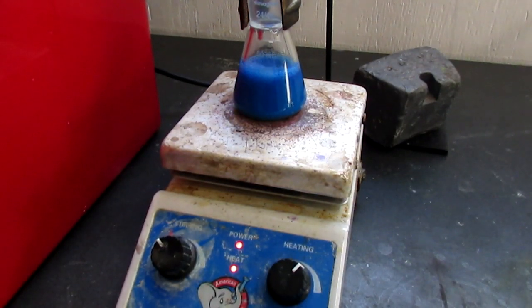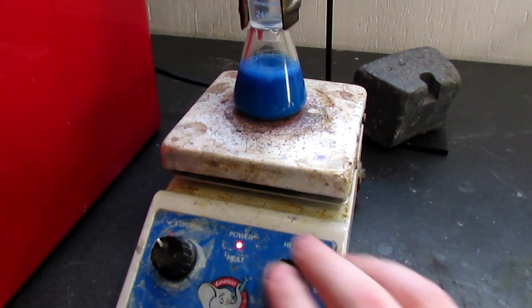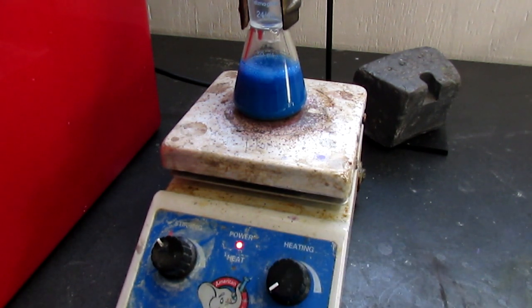It's now been refluxing for 15 minutes. I'm going to turn off the heating and allow it to start to cool. Once it stops refluxing, I'll take it off the heat and allow it to sit for 15 minutes, and then I'm going to filter off the precipitate, which should be our product.